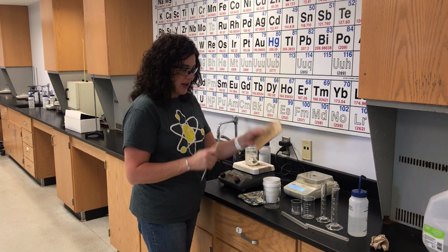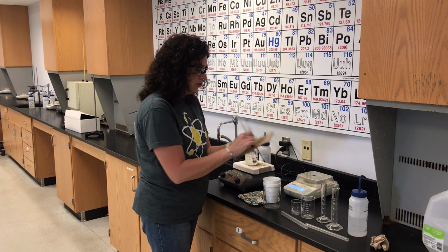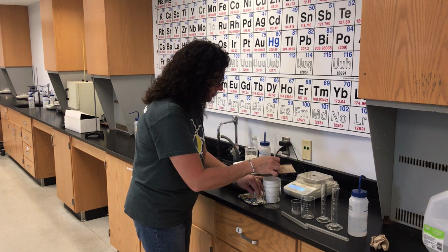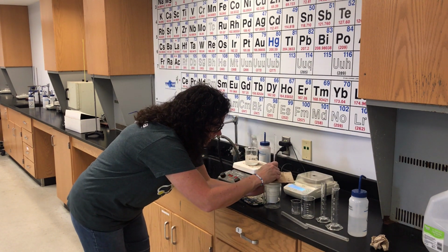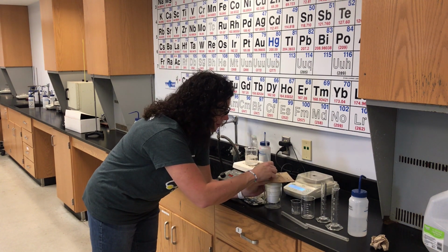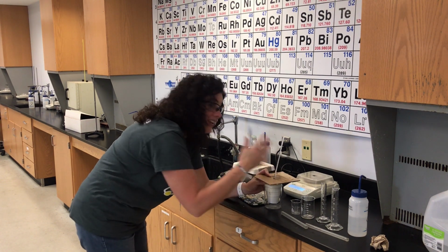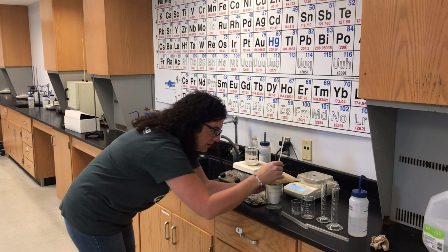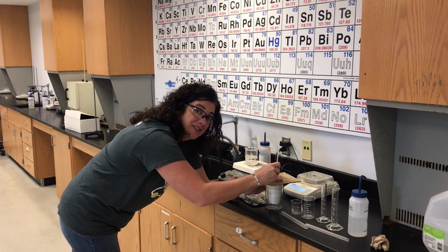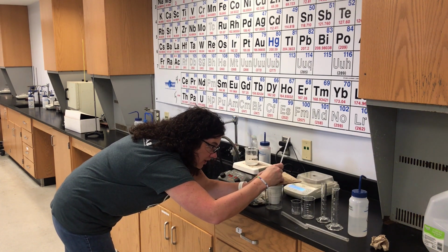When I measure the temperature of it, I've got a piece of cardboard that I'm going to use for my lid to try to keep all the heat in the calorimeter. So I'm going to quickly and carefully transfer hot metal into the calorimeter. I'm going to stir with my thermometer. How much do you think the temperature is going to go up? I always ask my students this. Okay? Think about it. I want you to have a number in mind. Obviously, you're not telling us your number, but you'd be surprised. Water has a very high specific heat. It takes a lot of heat, a lot of Q for the temperature of water to increase.